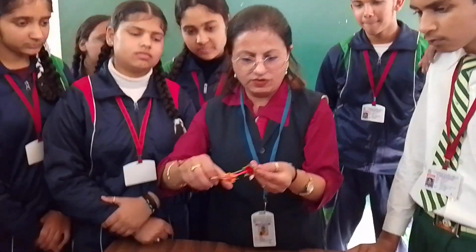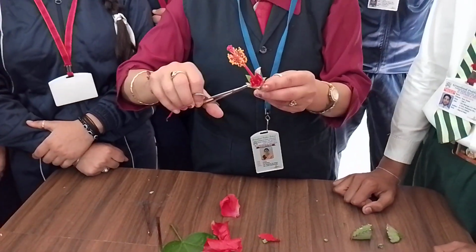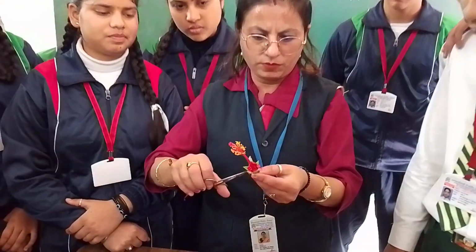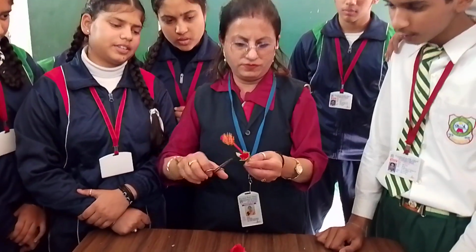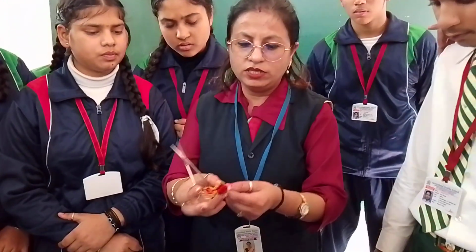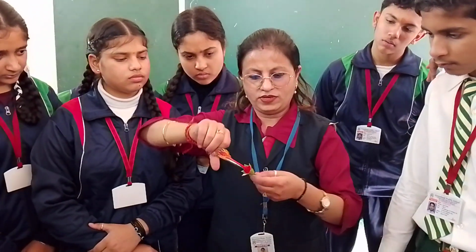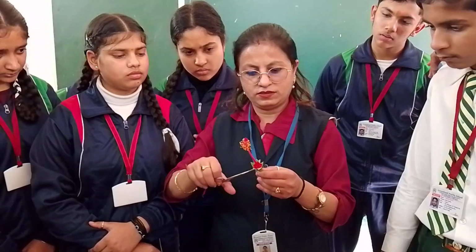So these were petals, and there is another kind, sepals, you can see, right? So these are separated ones. Count: 1, 2, 3, 4, 5 is already plucked, then 5, 6, 7, and 1 has been lost. Total 8. Right? So these are also sepals. They are joined, so we will cut from one side and remove it.